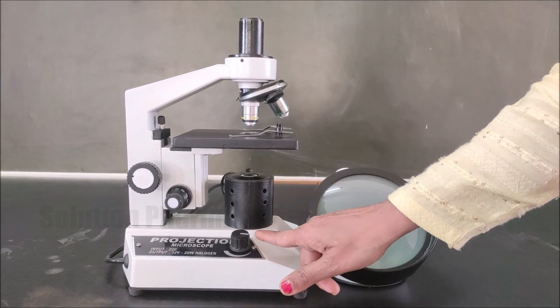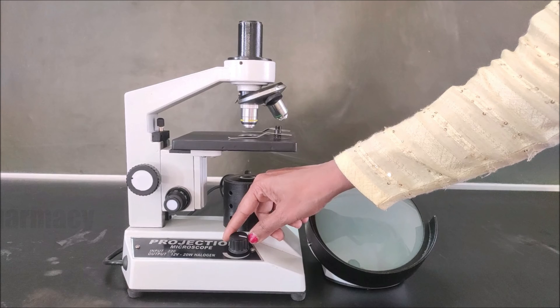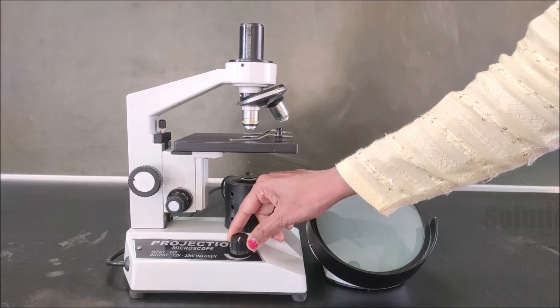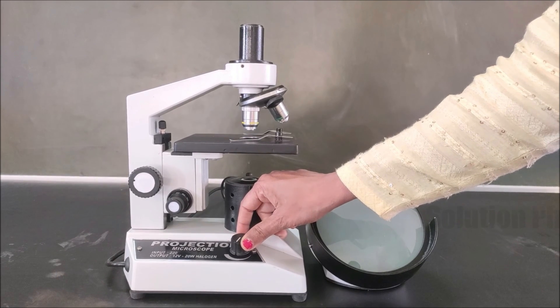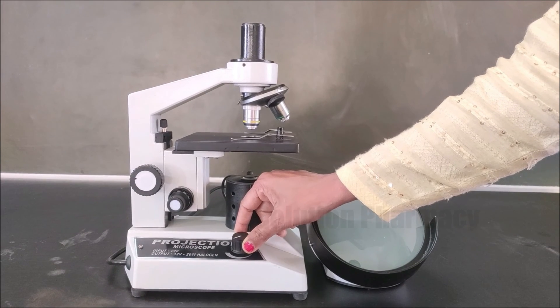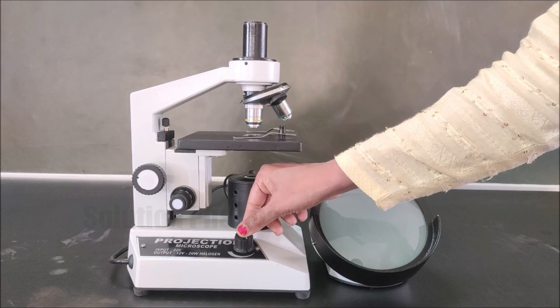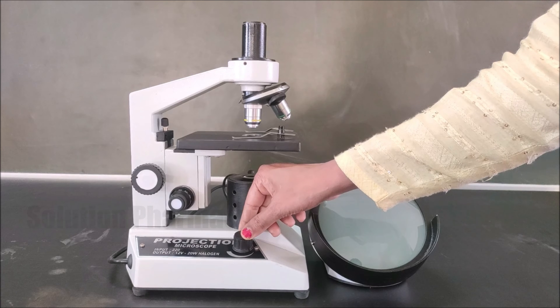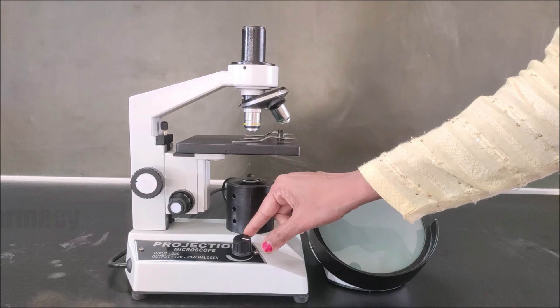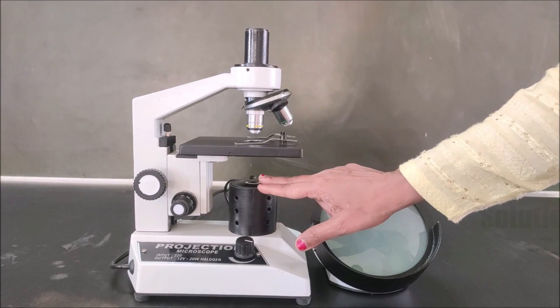We can move the light adjusting knob in both clockwise and anti-clockwise directions to increase or decrease the intensity of light — that is, the amount of light that reaches the specimen on the slide from the illuminator at the base. We can adjust the intensity of light by this knob according to our need.